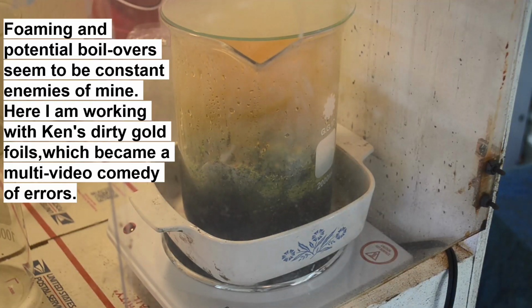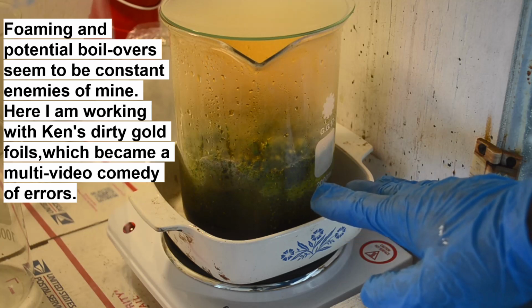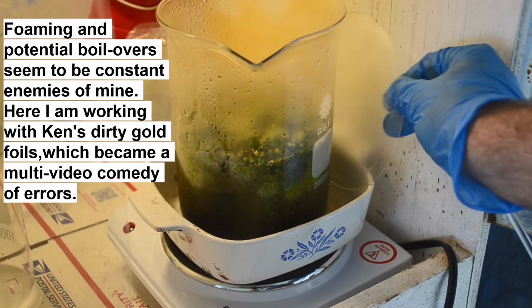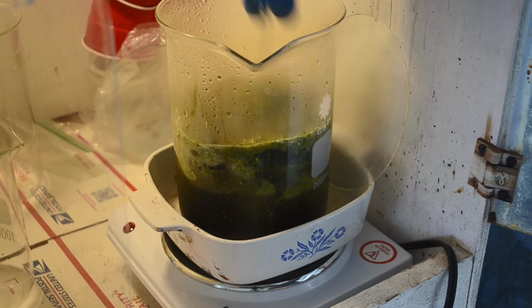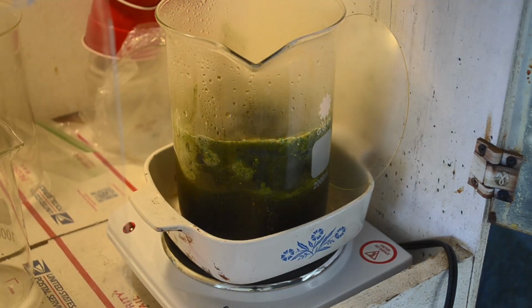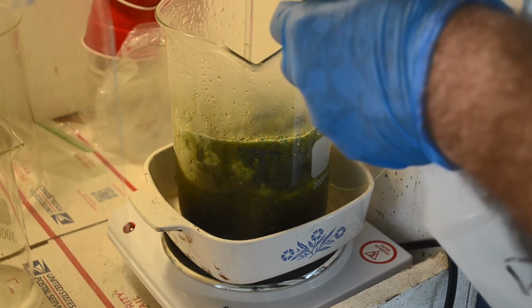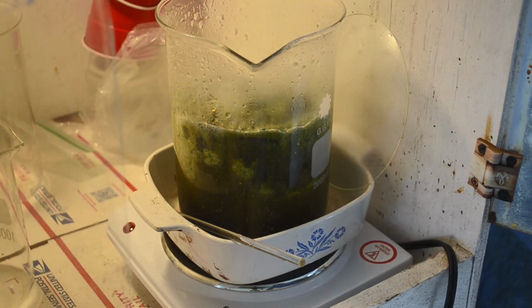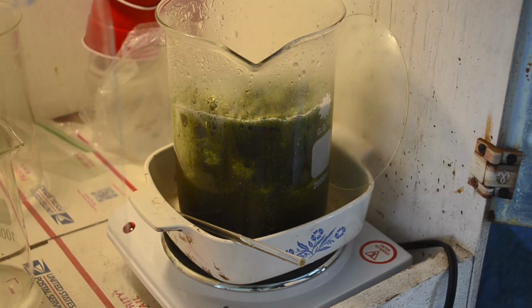Okay, it's a couple minutes later, and well, we got some orange fumes in there, which tells me that we've got metal reacting, but we are getting some serious foam too. Let me see if I can stir this foam down. Bust it up. Ooh, that seems to be making it worse. I'm thinking we may not have enough liquid in here for the amount of material I put in there. So let me put some more muriatic acid in here.